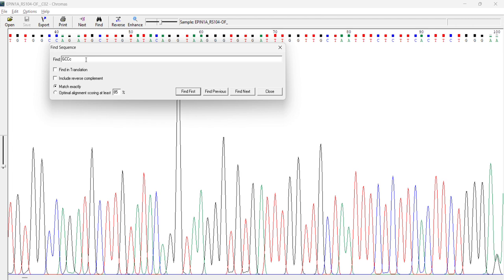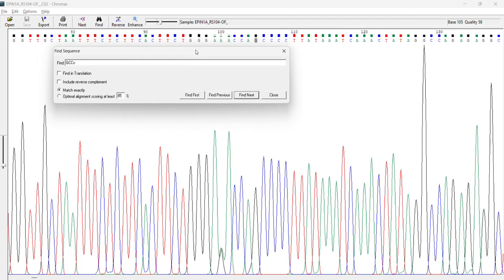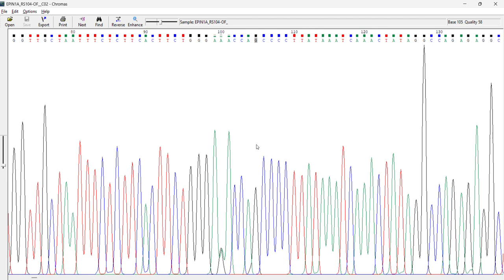Next one is the find option. You can just type any of your sequence. For example, if I type GCC or anything you want to search particularly, you just type it here and click find next. If it is there in your sequence, it will find it. So you can see here GCCC like that. So this is the use of this find option.